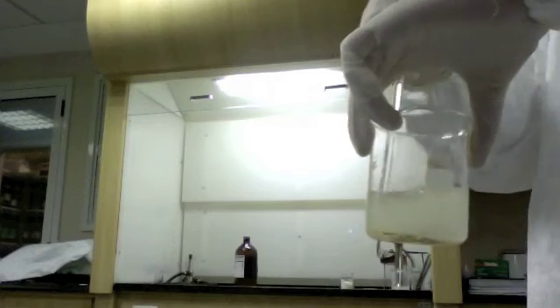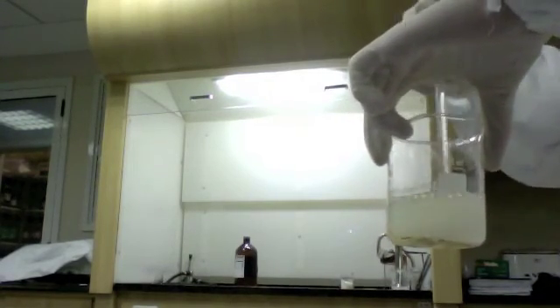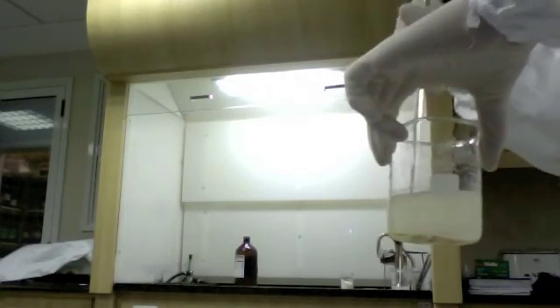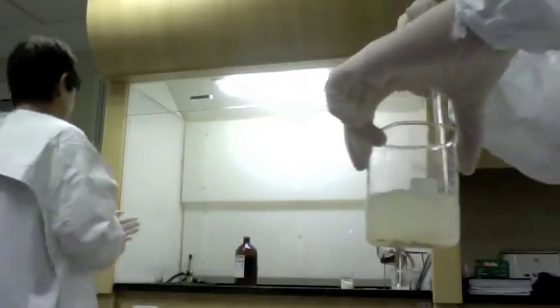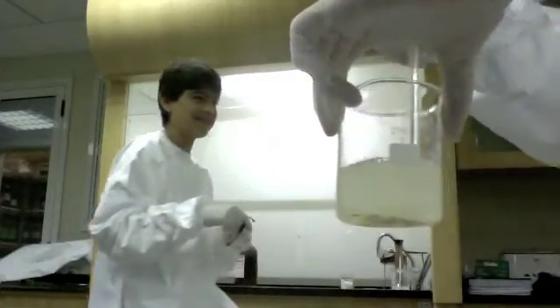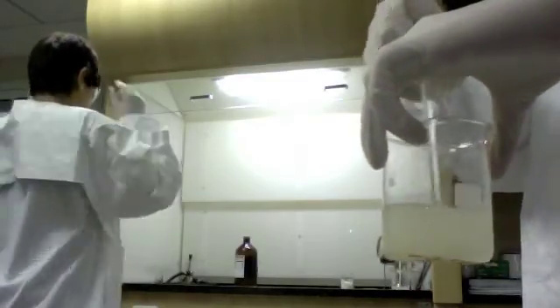Procedure. First, clean the table and organize the work environment. Then, get 3 beakers, 1 large and 2 small. In the larger beaker, pour in 125 ml of water. In one of the smaller ones, add 50 ml of sulfuric acid. In the one that's left, add 75 ml of sugar.